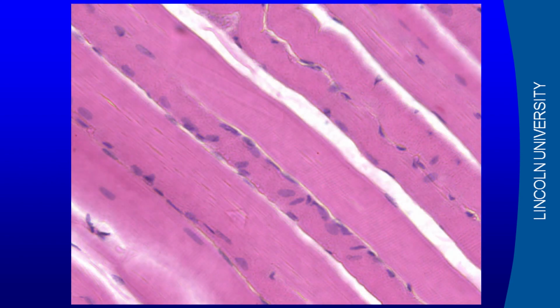Over on the bottom left here we've got the fibres cut end on, and it gives it that grainy appearance. And if we go to a further magnification, here these are the individual muscle fibres. These sort of bluey purpley coloured discs are the nuclei that are all along the outside of those fibres, and you can just about see the banding across the fibres that gives them the name of striated muscle.